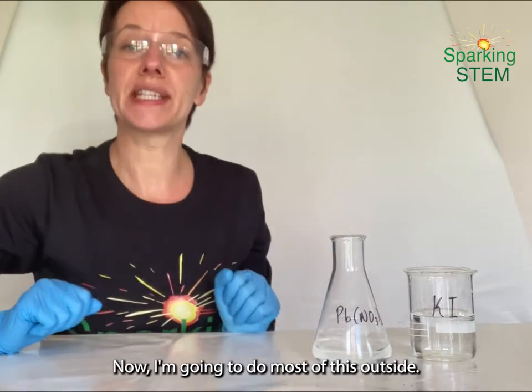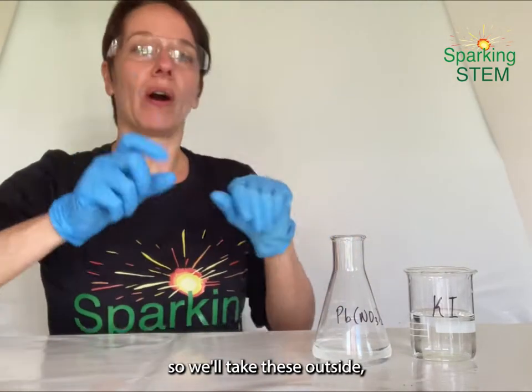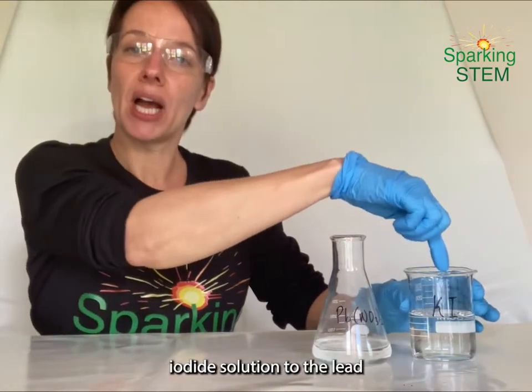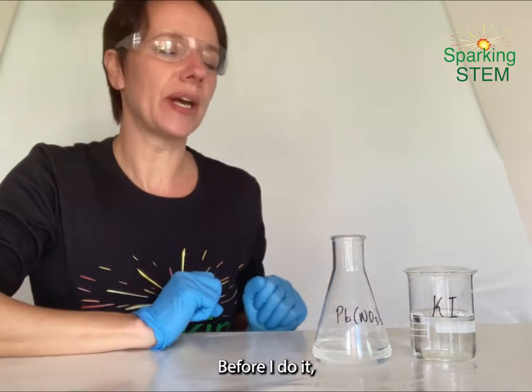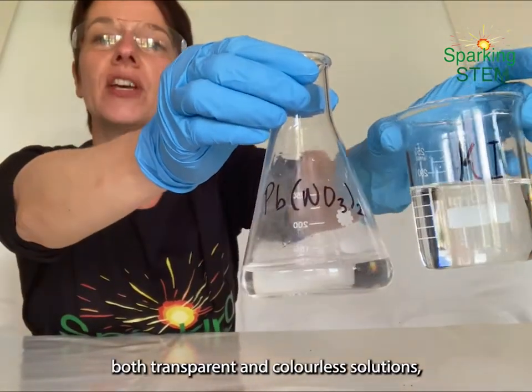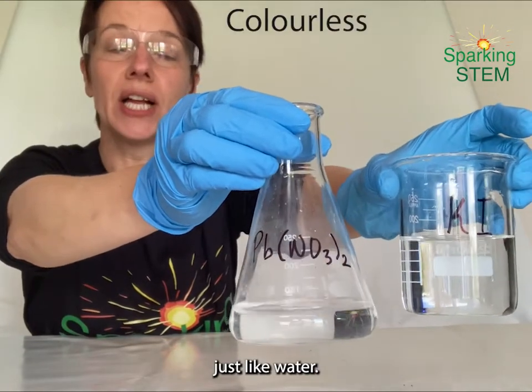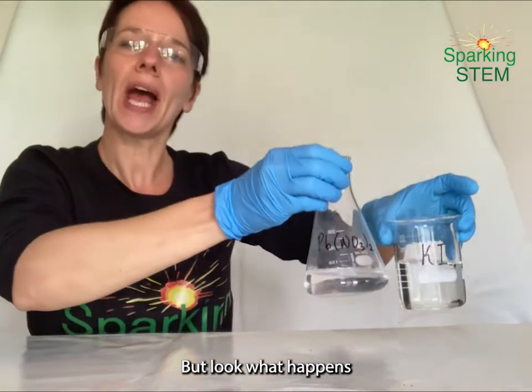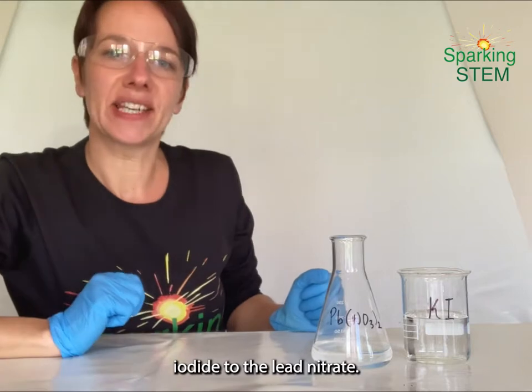Now I'm going to do most of this outside and I'm going to need to do some heating, so I'll take these outside. We're going to add the potassium iodide solution to the lead nitrate solution, and before I do it, just take a quick note, look at these very carefully. You'll see that they are both transparent and colourless solutions, just like water. They have no colour and the light can get straight through them. But look what happens when I add the potassium iodide to the lead nitrate.